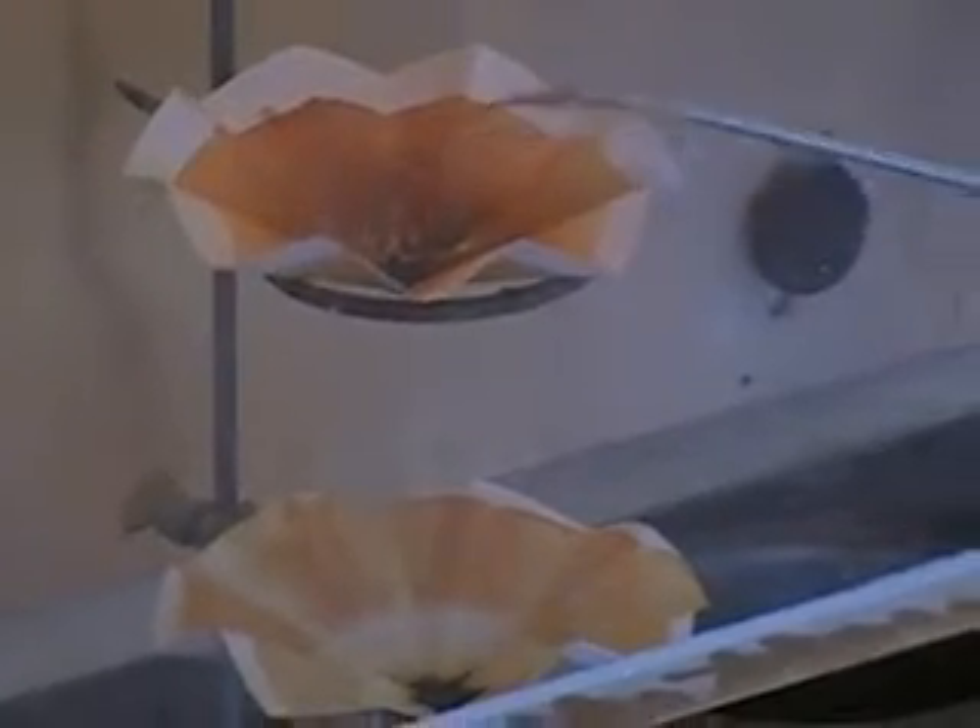Okay, so if everyone's ready. No, the feather's not doing it — I've seen that done, but it didn't work that time. So I will use a poker instead. Are you ready now? And you'll see quite a lot of purple gas again.